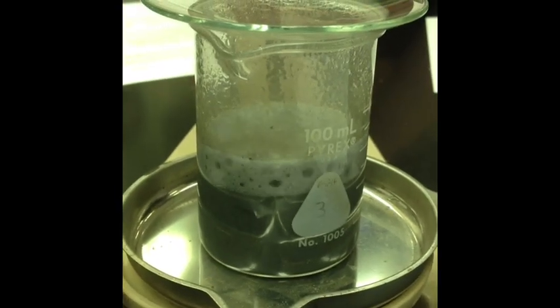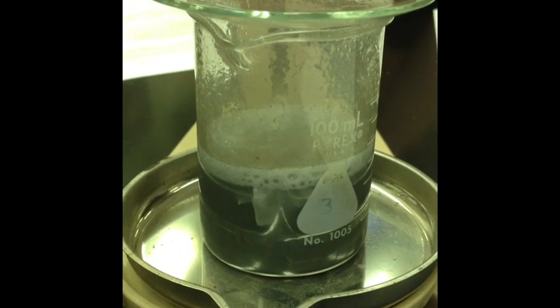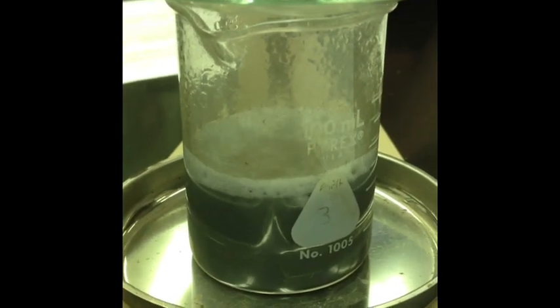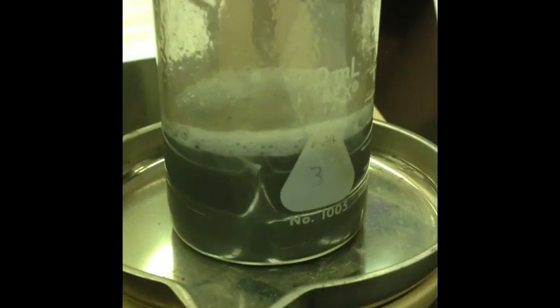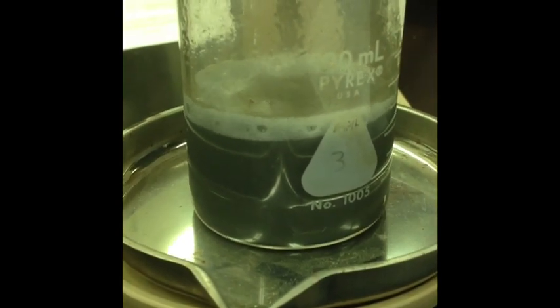That's pretty cool, isn't it? It is. Yeah. It's supposed to be hot. I wonder what's going to be left of the aluminum, if anything. Just black stuff. It kind of just dissolved in a matter of a few seconds.